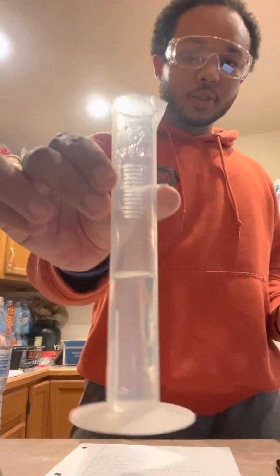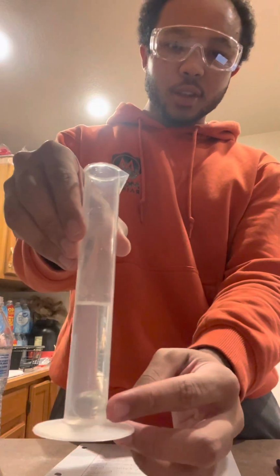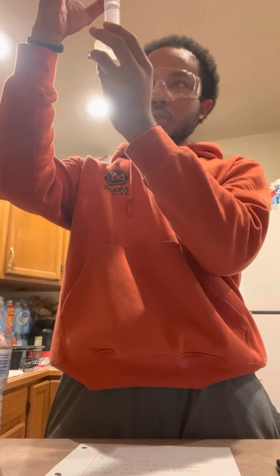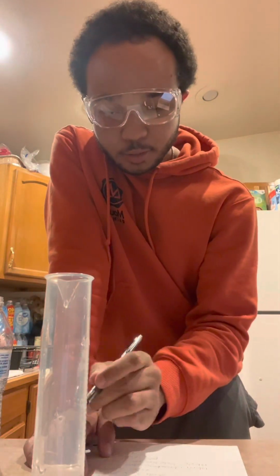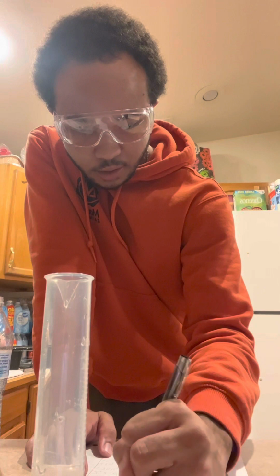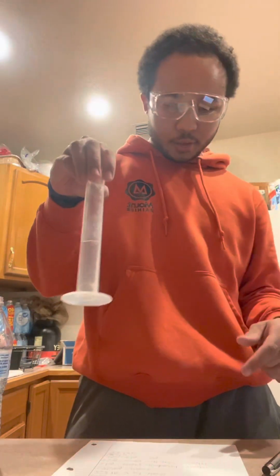So we got our glass sphere, we got our graduated cylinder with water in it, so we're gonna drop it in there. You can see it right there at the bottom. So if we look, it has gone up about 2. So I'd say it's about 27 milliliters, since that's a certain, and we need our uncertain also, so 27.0 milliliters. And that's the volume of the water with the glass sphere.